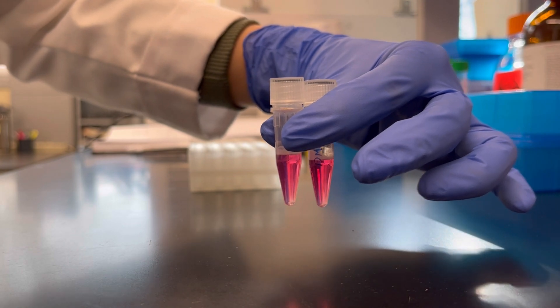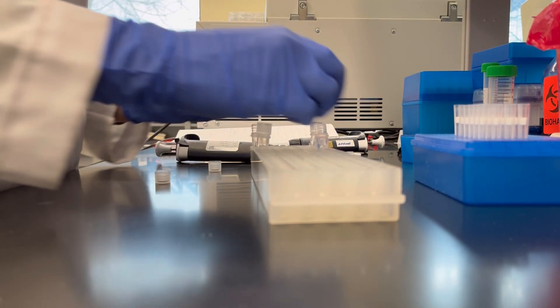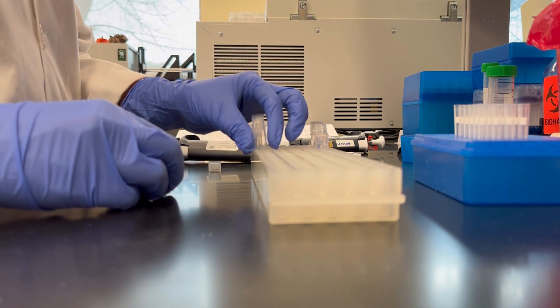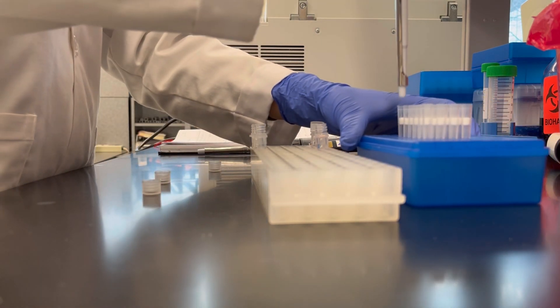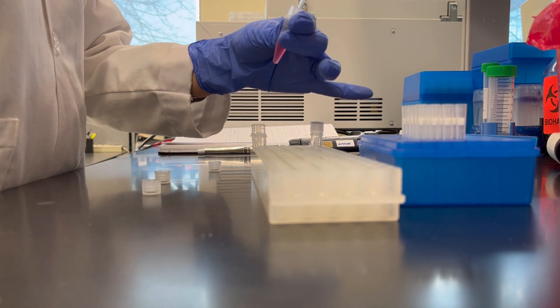The mixture separates into 3 layers. RNA remains in the upper colorless layer, so transfer this layer into a new cap tube without touching the white interface layer.